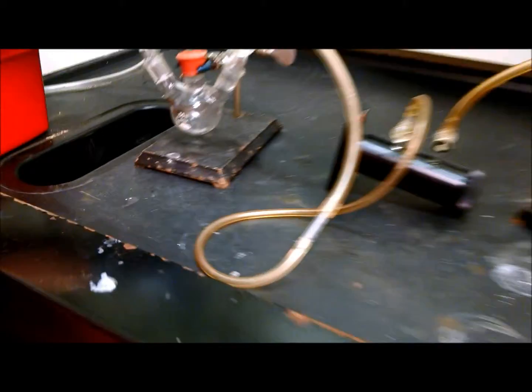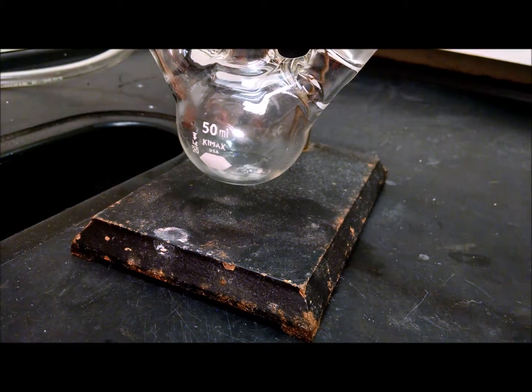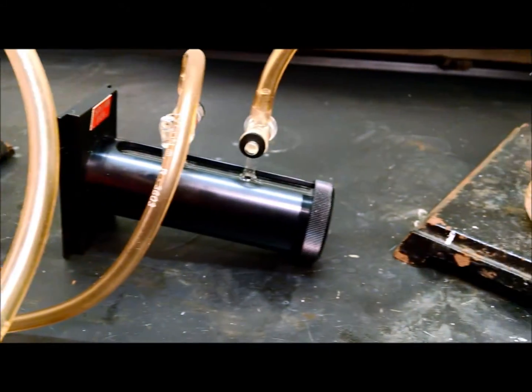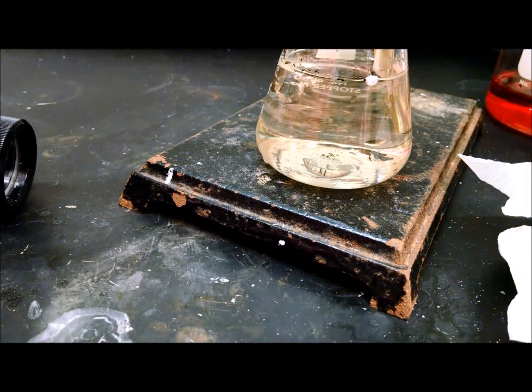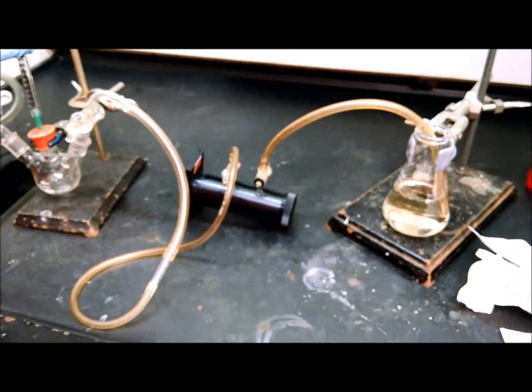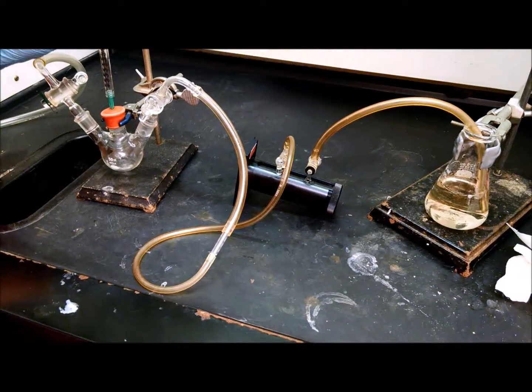And it's starting to bubble, generating hydrochloric acid gas. It goes into the cell and into the indicator solution. When that solution turns red, then we know we've completely filled the cell with the gas.